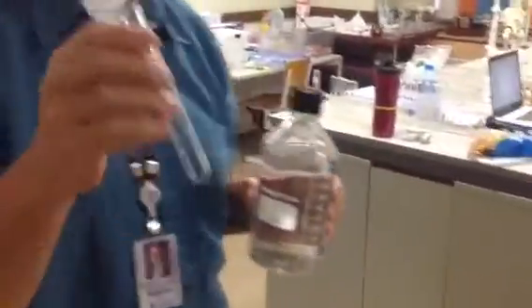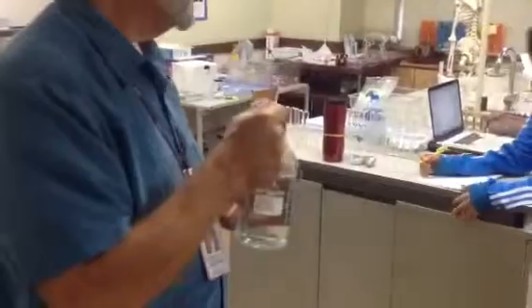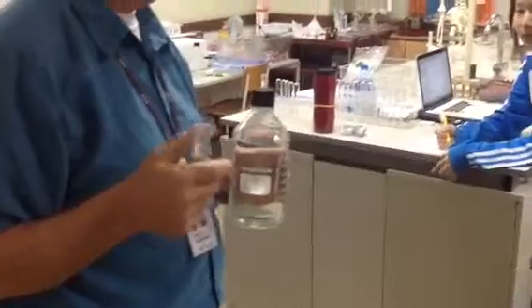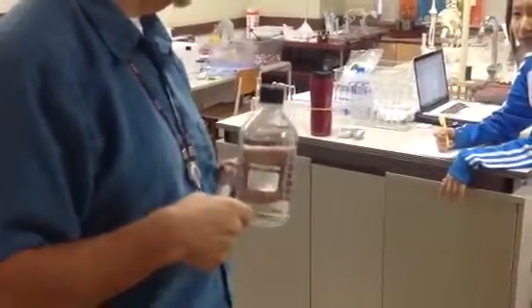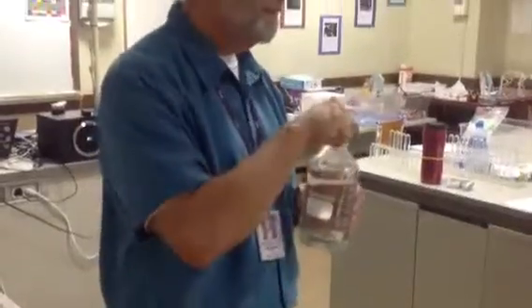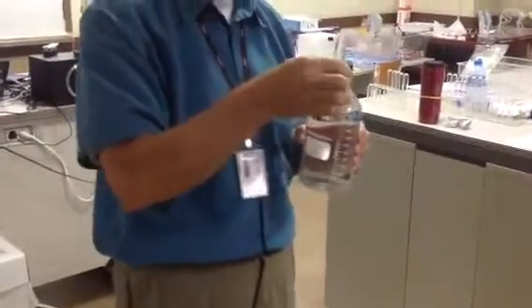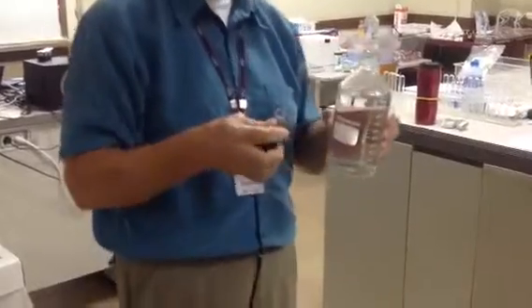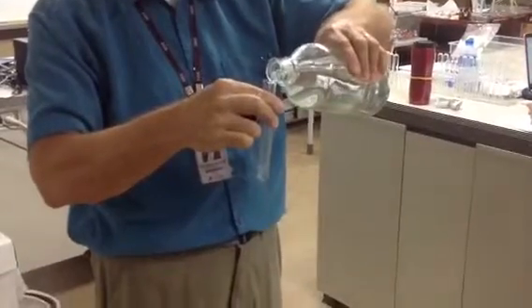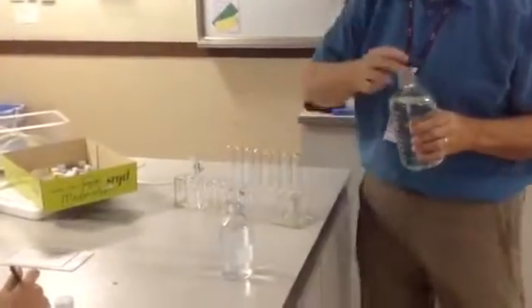So I'm about to pour some of this into a test tube. You will want to think about everything I'm doing. I'm doing it very sloppily, at a level 1 or 2. You're going to want to improve upon what I'm doing, but you will get the basic idea of the process of the lab. But very basic, right? So think about what I'm doing and how you will improve upon it as I do it. Okay, so I'm going to pour some H2O2 into this test tube. That's kind of a hint. Okay? 6%. It's going to go over here.